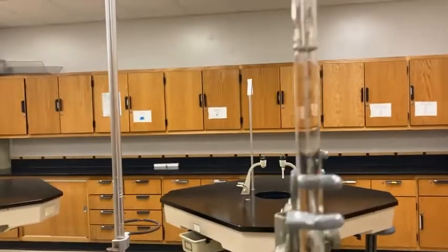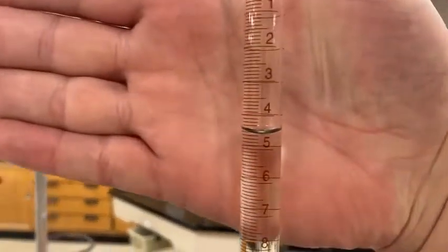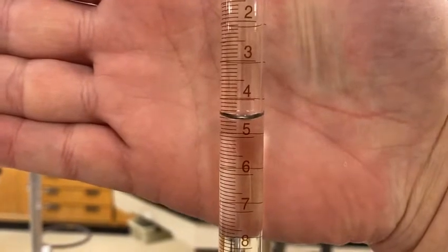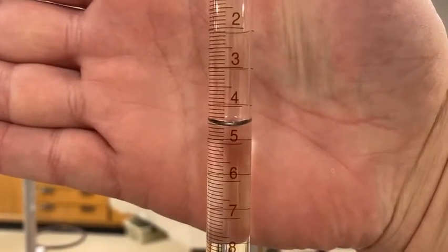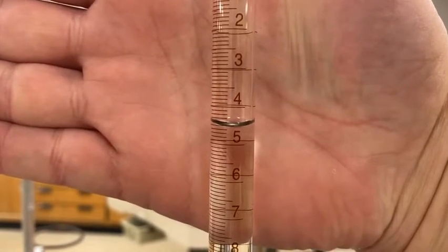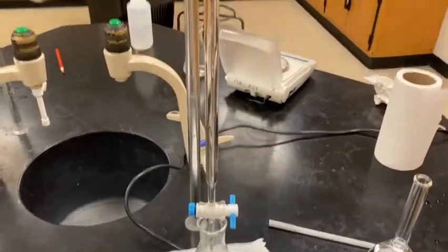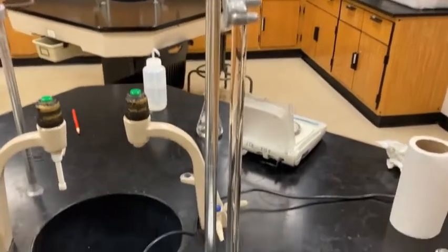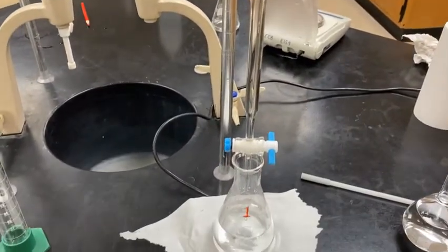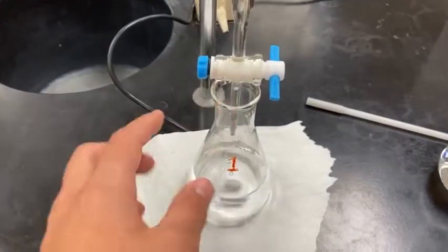Cool. So I'm going to have this as my starting point. I'm going to put my hand behind the burette, and then if you guys could read the initial volume, this will be the starting point for our burette. Okay. Now with the base in the burette and we have the initial reading, we can actually start our titration. So you'll notice how I've set this up. The burette, I actually lowered down into the flask.